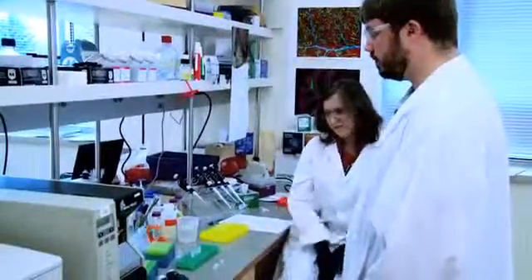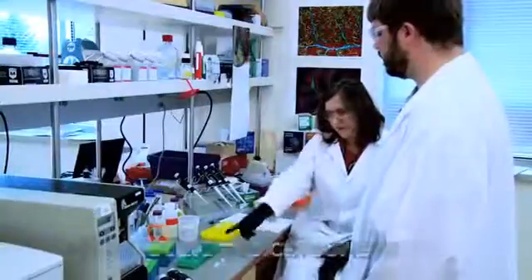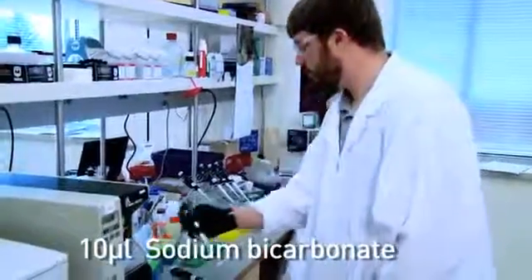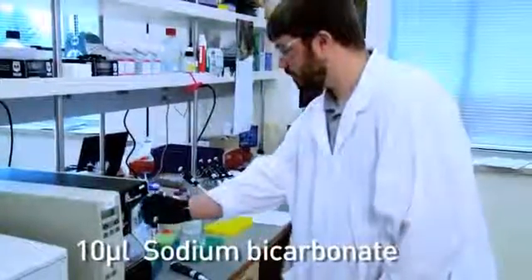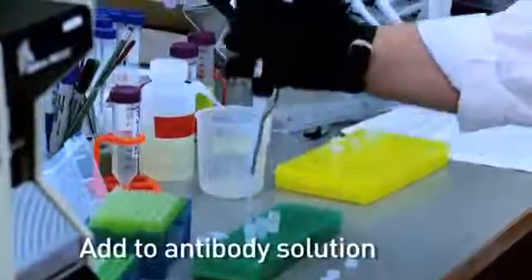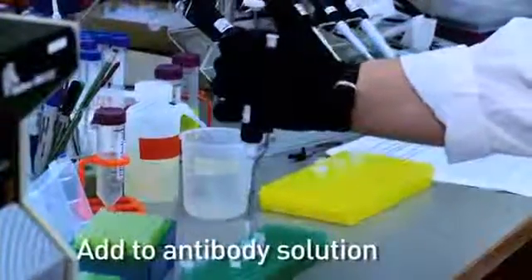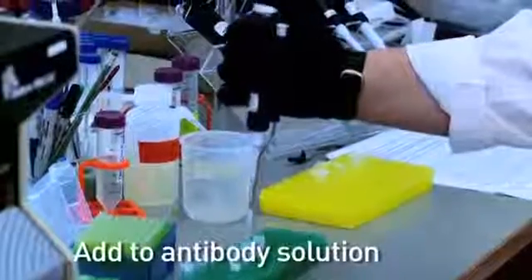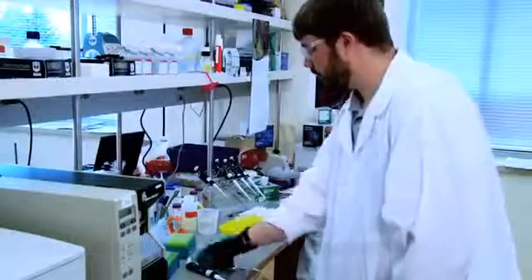You're gonna do a very simple reaction. You're gonna add 1/10th volume, or 10 microliters, of your sodium bicarbonate solution into your antibody solution, and then you're gonna mix that. Then you're going to add 100 microliters of your antibody solution and add it to your dye mix well.